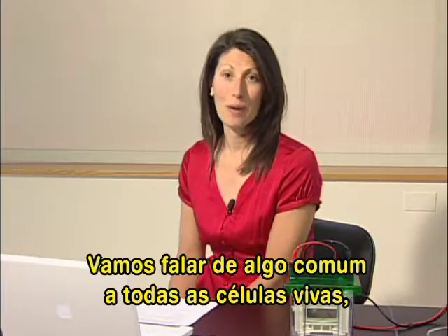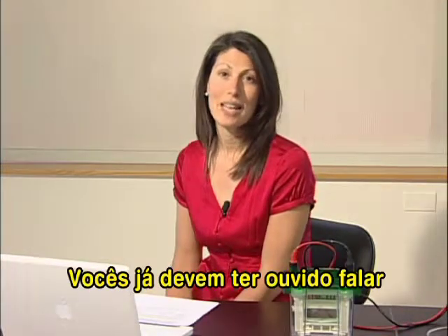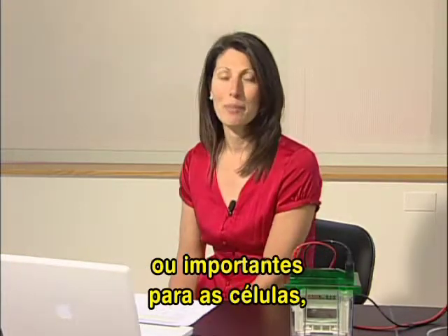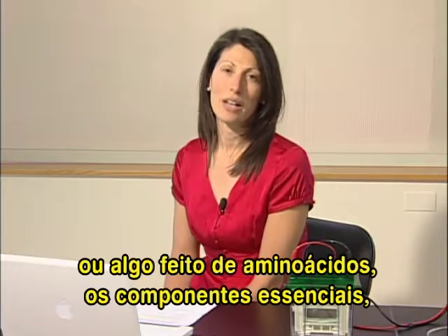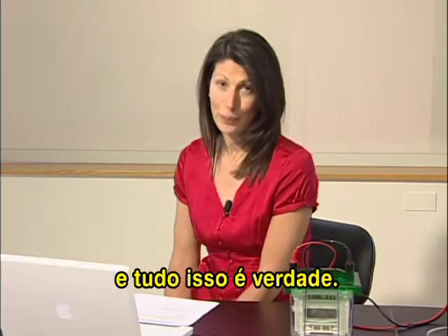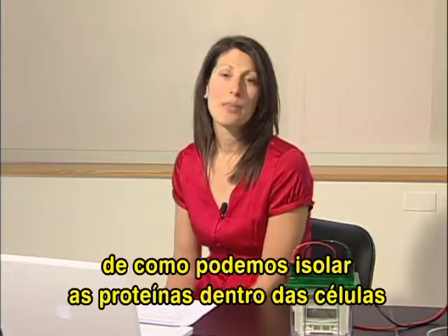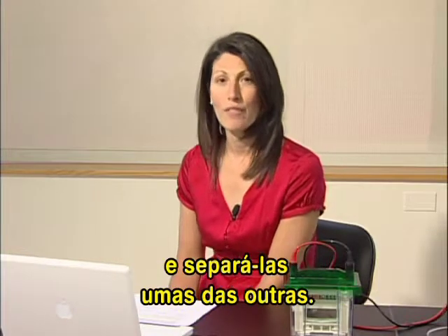I'm happy to have you here today in my teaching laboratory, and we'll talk about something that's common to all living cells, namely proteins. Now, you may have heard about proteins as something that's important for building muscles, or something important for living cells, or even something that's built from a building block called amino acids, and all that is true. But today we'll be talking about something else, namely about how you might tweeze apart proteins inside a cell and separate them one from the other.